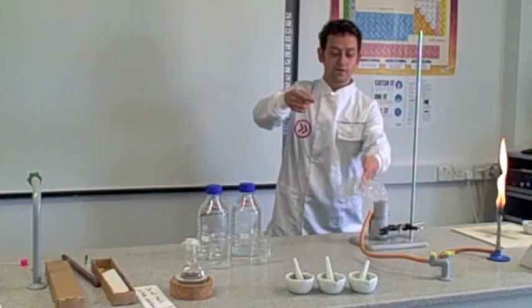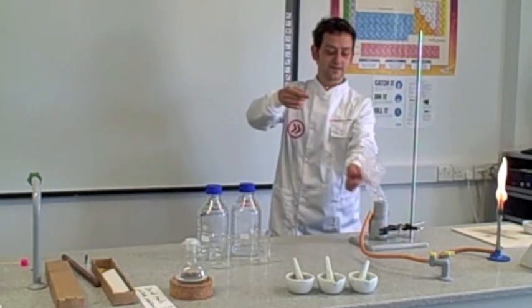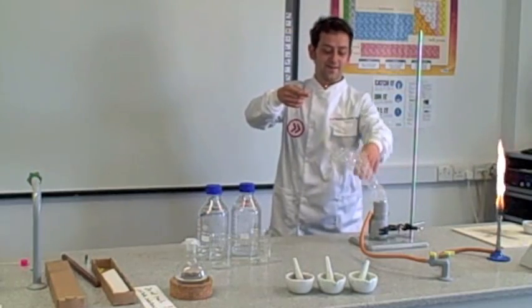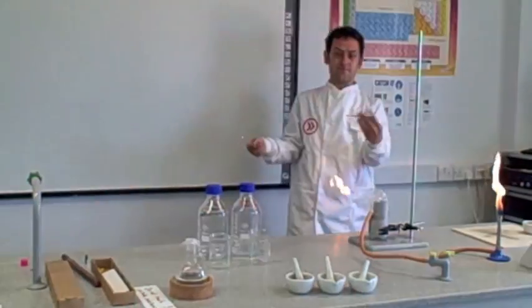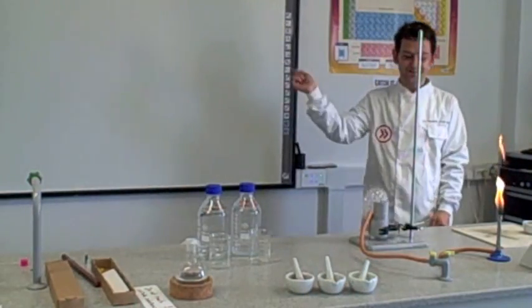I'll detach this piece. It never quite works the same twice. Methane is actually lighter than air. So, eventually, there you go. That's flammable.